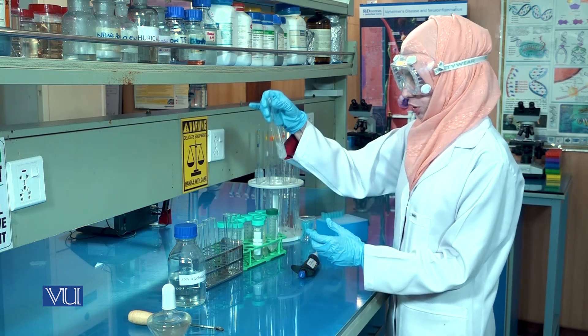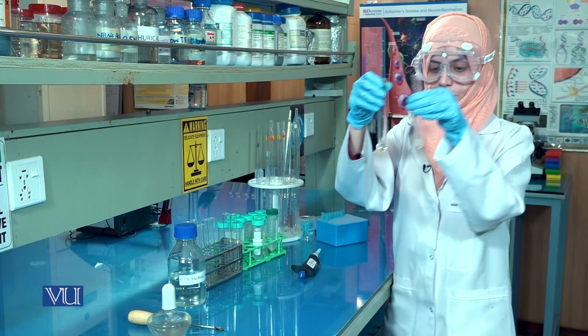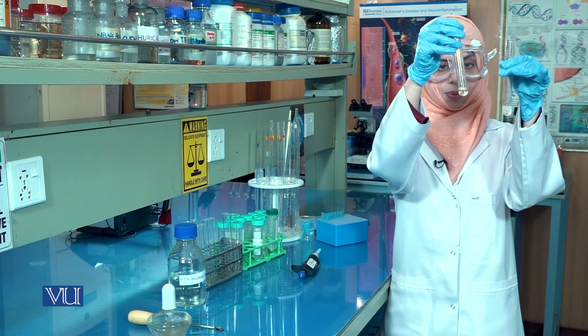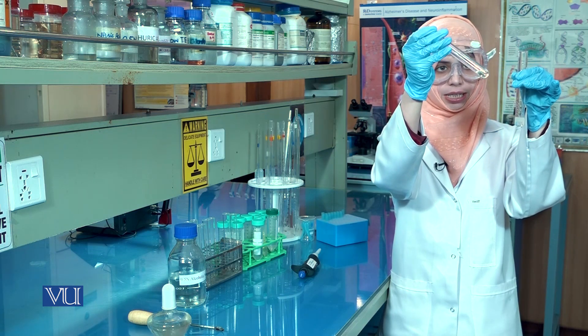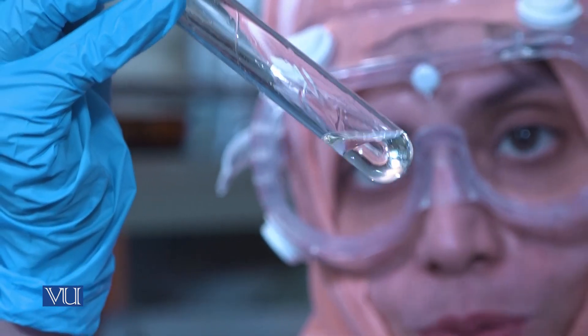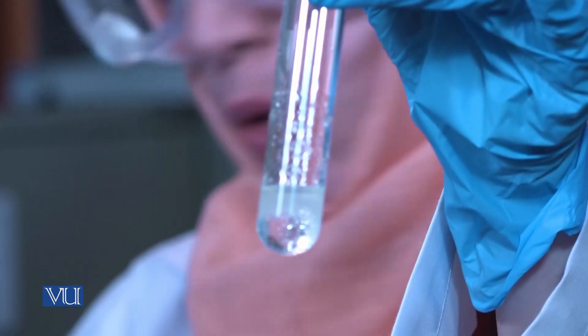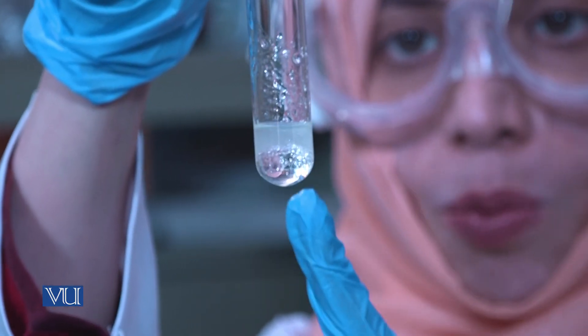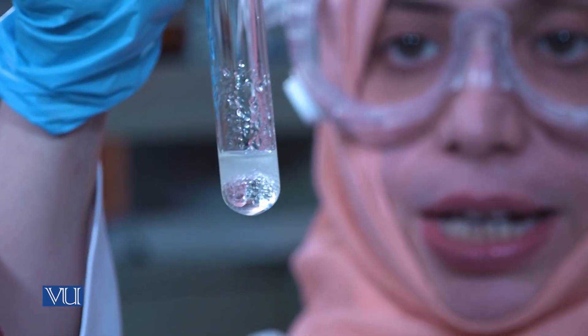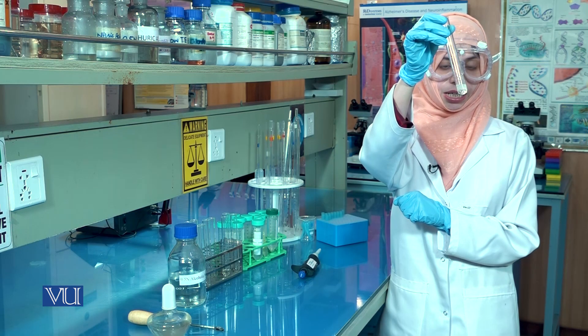Mix the contents of both test tubes. You will observe that the test tube in which chloroform was added gives a clear solution, indicating that the fat sample is soluble in chloroform. Whereas the test tube in which water was added contains two distinct layers — one layer contains oil while the other contains water. This further confirms that our sample contained a lipid.